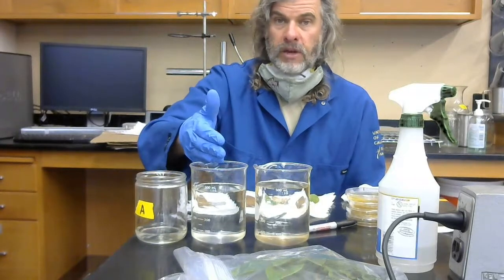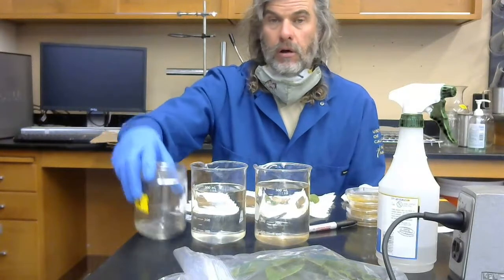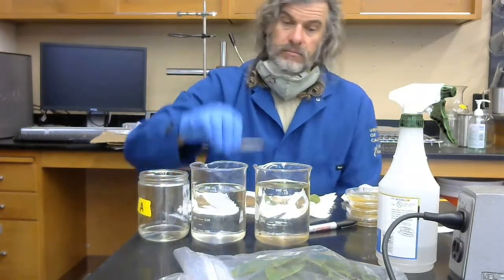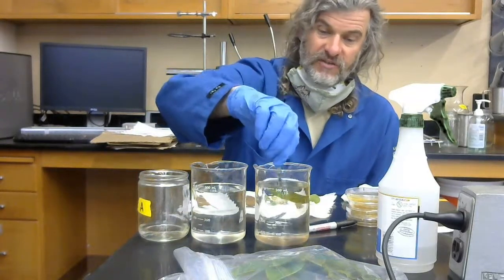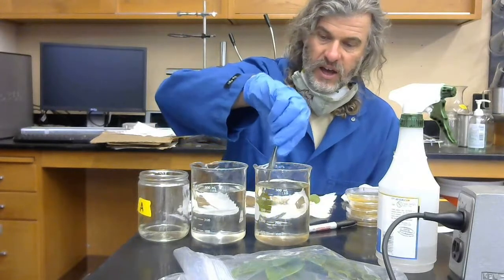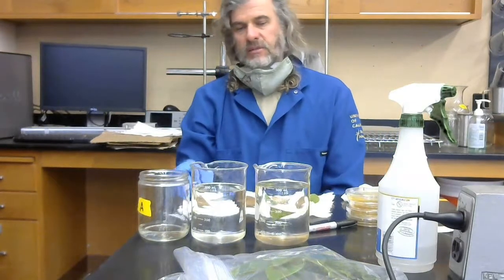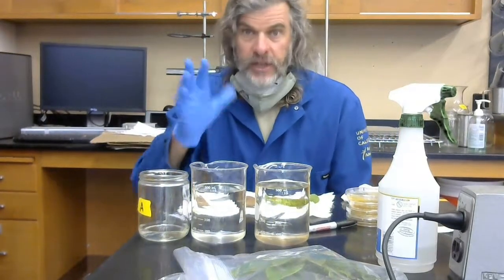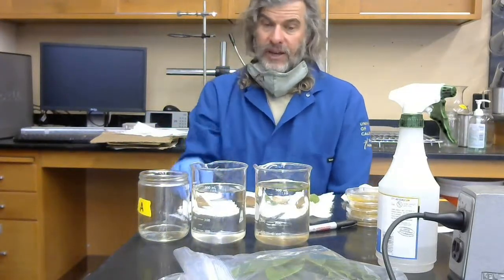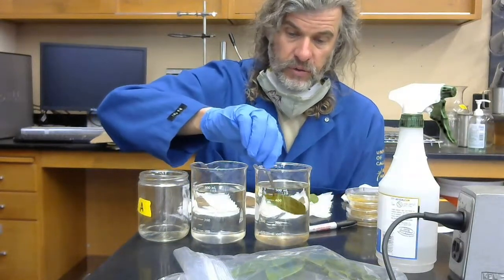I've got a beaker of water here, and then I've got a beaker of ethanol as well. And what I'm going to do is put my leaves, just imagine me having 5 leaves from the canopy of this sumac here, into this bleach solution. 10% bleach, household bleach, will damage your clothes, so be careful with it, but it is generally not hazardous to you, not any more than any other household chemicals.